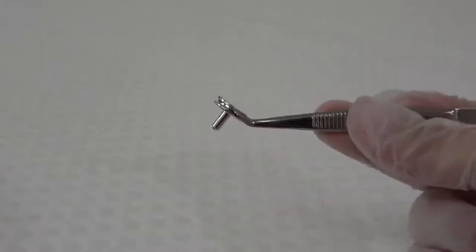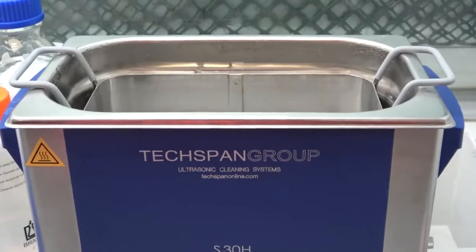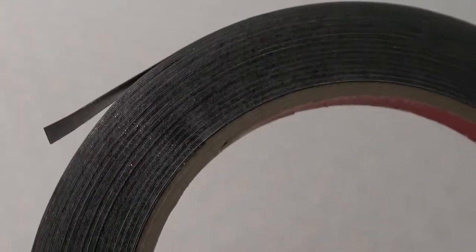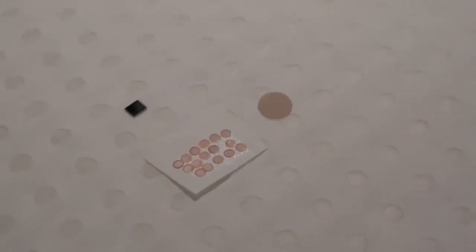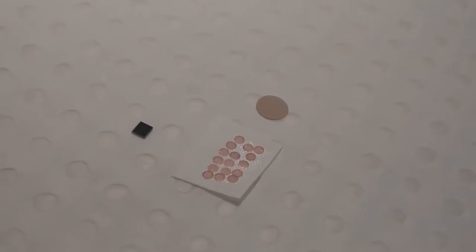You will also need a small SEM stub, an ultrasonic bath, tweezers or forceps, a micropipette or disposable fine tip pipette, double-sided adhesive — at the EMU we provide users with double-sided conductive carbon tape — scissors, and a substrate. Common substrates include silicon wafer pieces, small glass cover slips, Formvar-coated TEM grids, and freshly cleaved mica sheets.